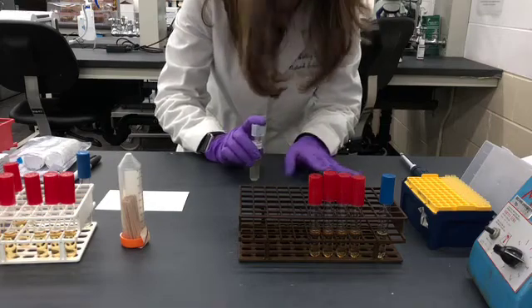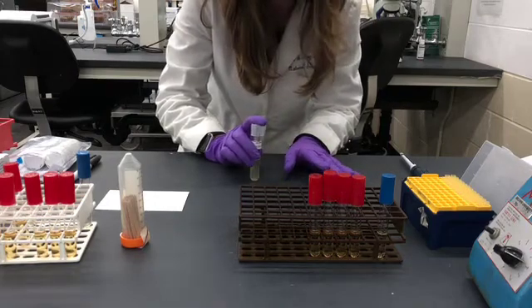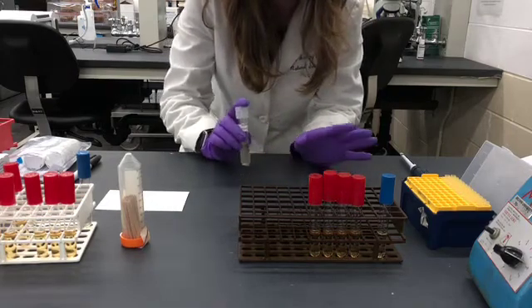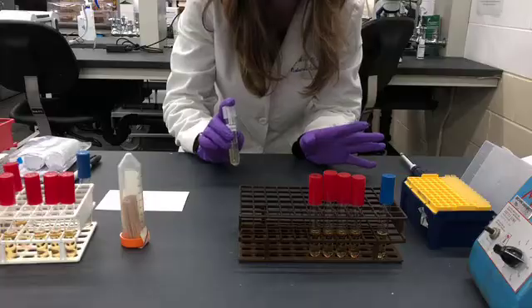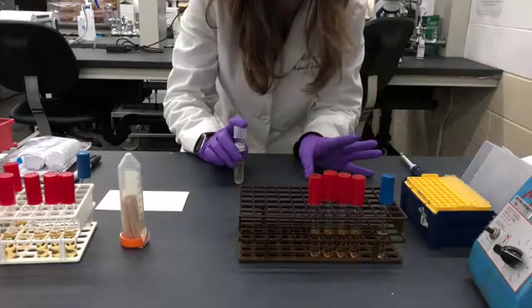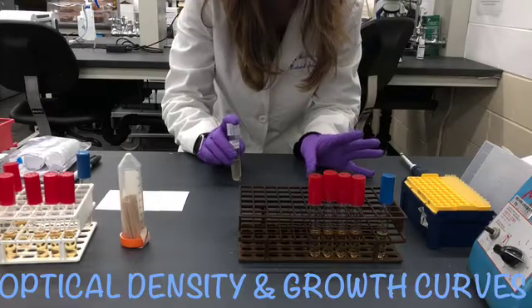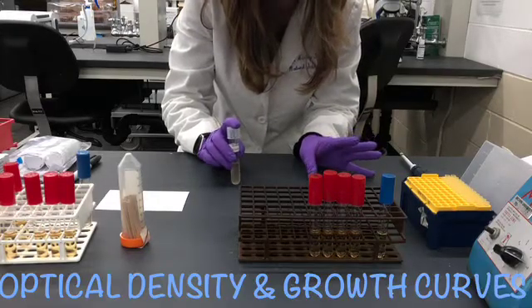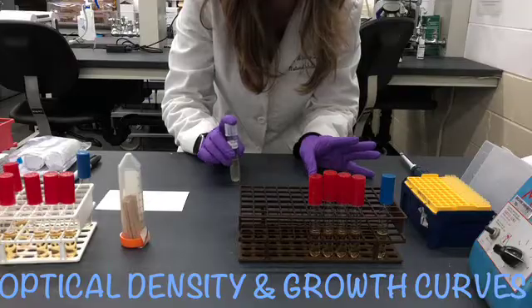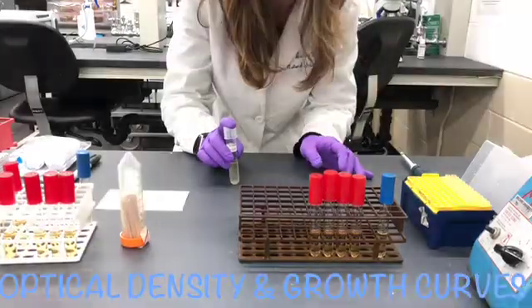Hi everyone. This assay is going to involve measuring optical density and making a growth curve in order to determine the temperature preference of our microorganism.